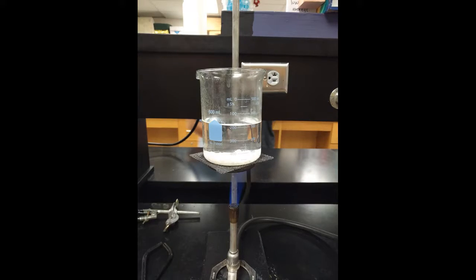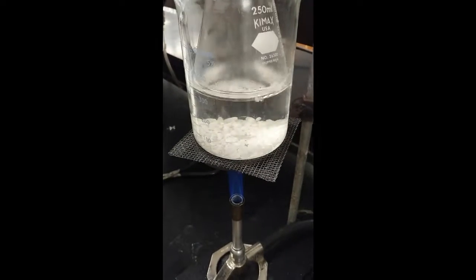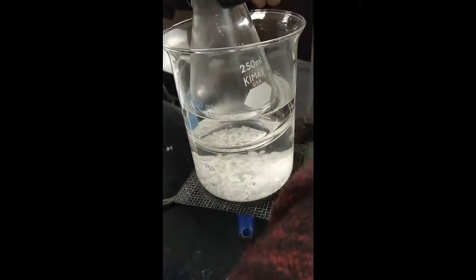Step 4. Heat the water in the beaker to boiling. When the water is boiling, adjust the temperature of the flame so that splashing water does not hurt you. Step 5. Submerge the flask into the boiling water so that the bottom of the flask is covered by the water. Clamp the neck of the flask.